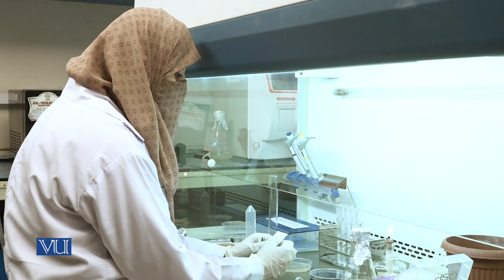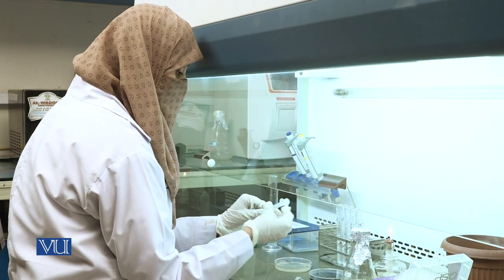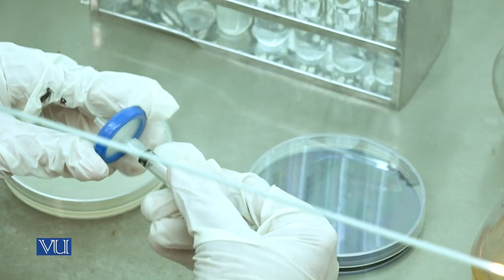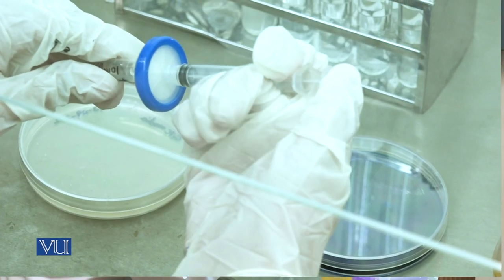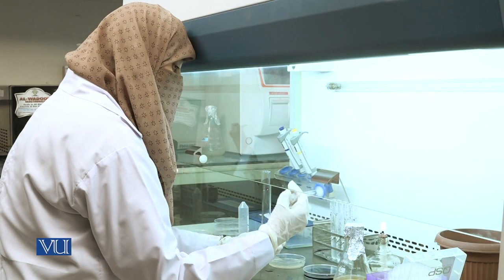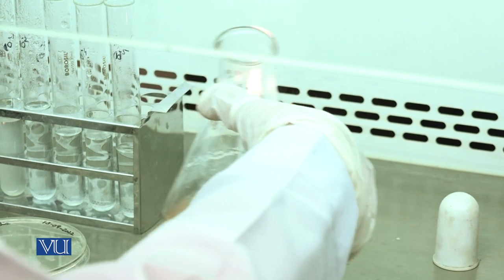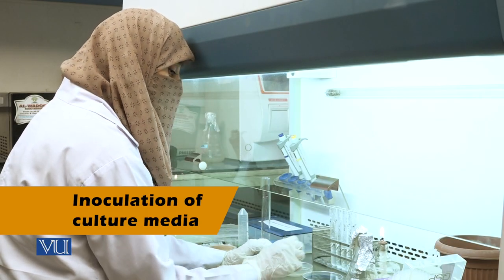For addition of antibiotic, we use a syringe filter. This is the syringe filter. Place the syringe filter and adjust it on the syringe. Now take the antibiotics and add the antibiotic solution to the media.